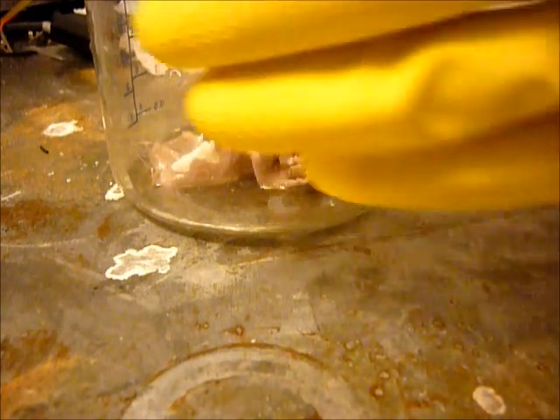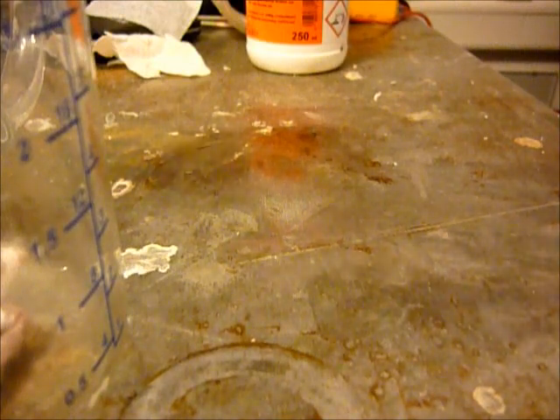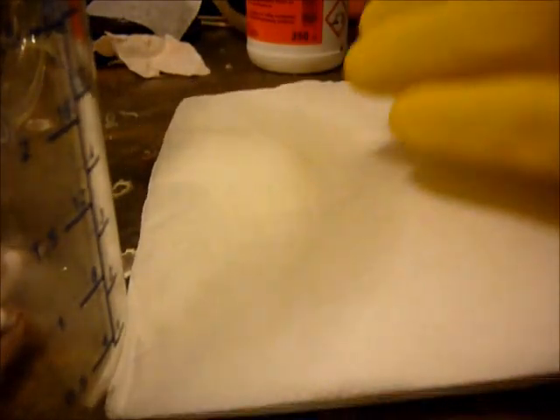So, while the sulfuric acid is doing this, I will make a second experiment. For this I need a piece of paper and again sulfuric acid.